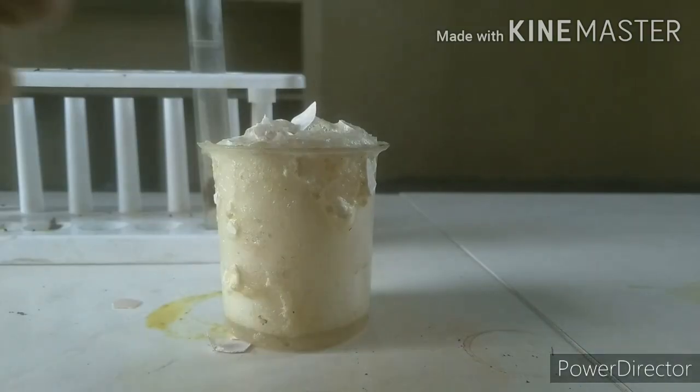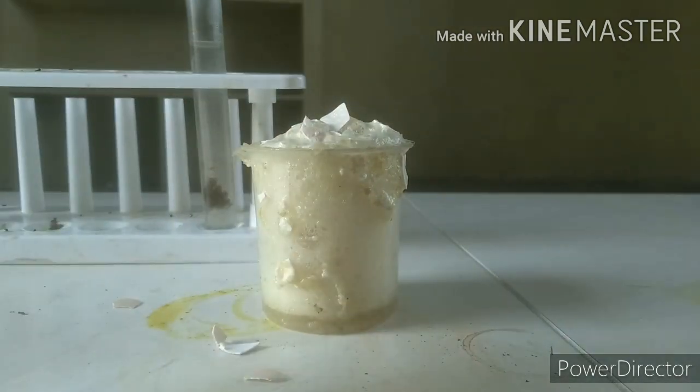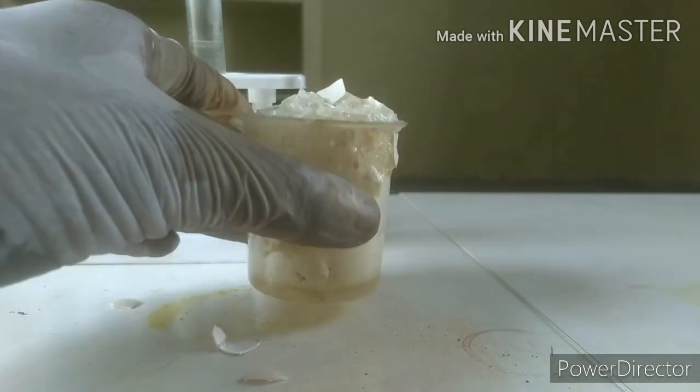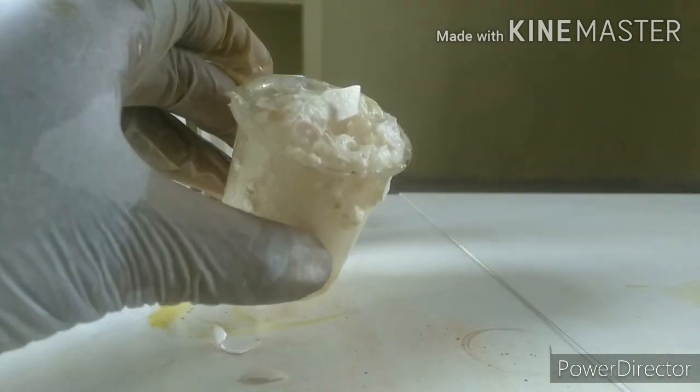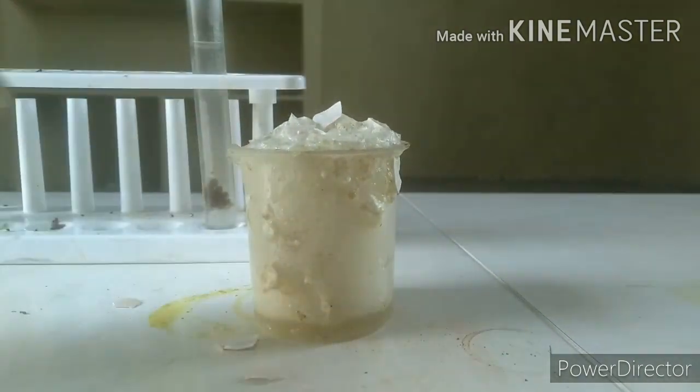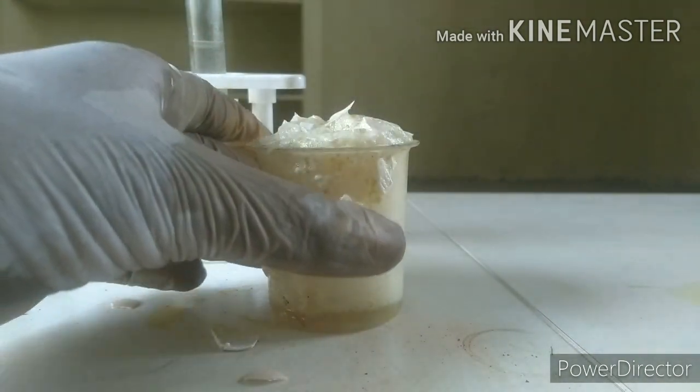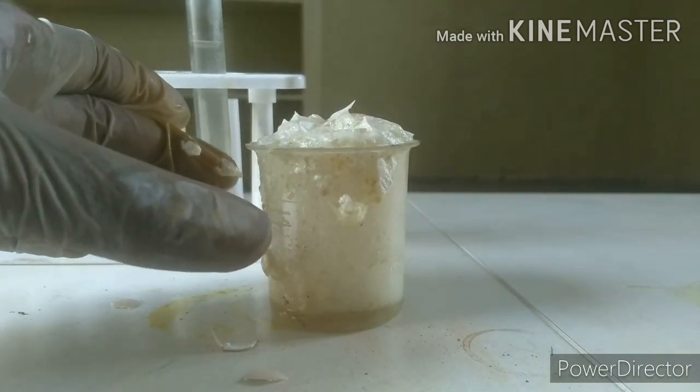It has been a while and as you can see it stopped fizzing. It really did a lot of fumes and also a lot of foam out of this, so better keep this off your face for a while when this fizzing goes on. I'm going to be filtering this off to get calcium chloride.